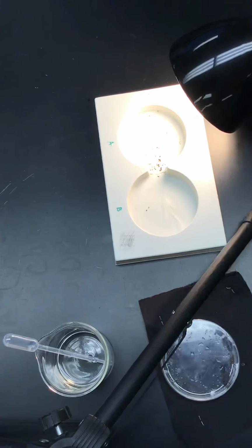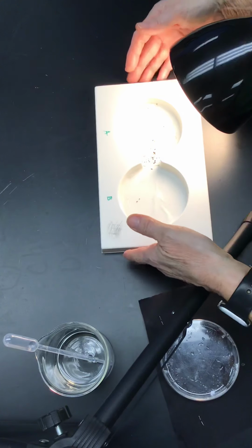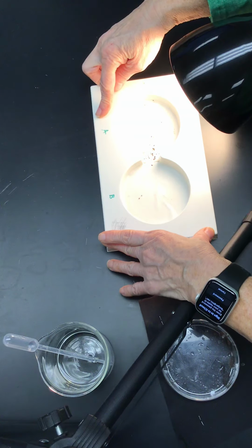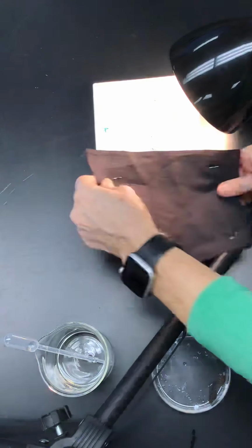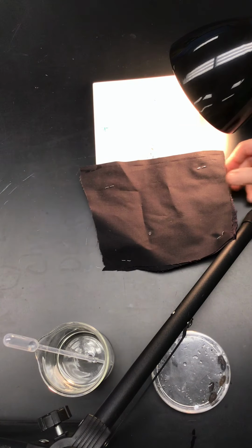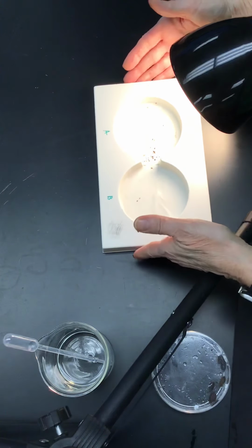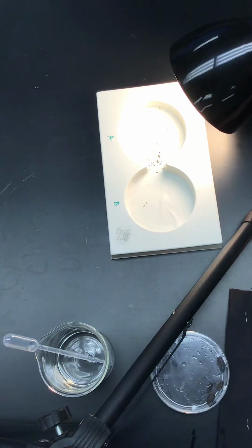I have a light here that is set on this behavior chamber. Again, we'll review what the parts are. This is a behavior chamber. The light is shining on the A side, and we're going to put a dark cover over the B side, like that. I will place the pillbugs in the middle of the chamber, and we will see which direction they will go. This light is actually pretty warm, so my hypothesis would be that they would gravitate toward the dark environment, but you never quite know. So here we go.